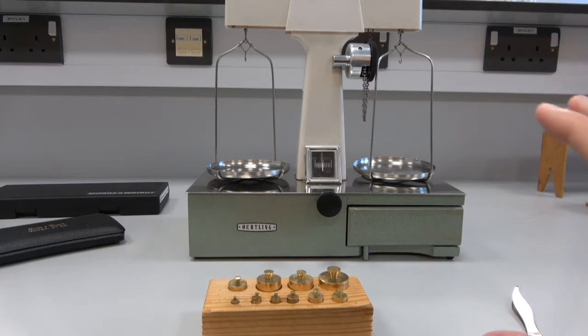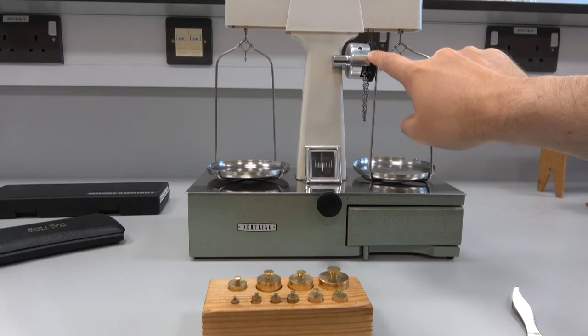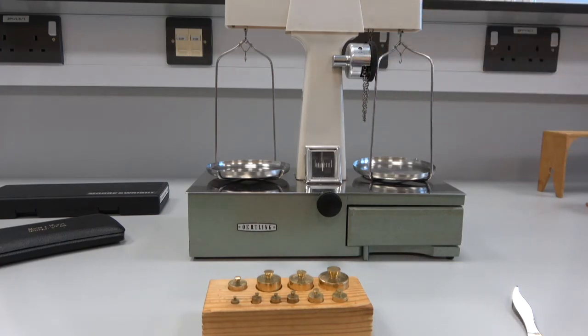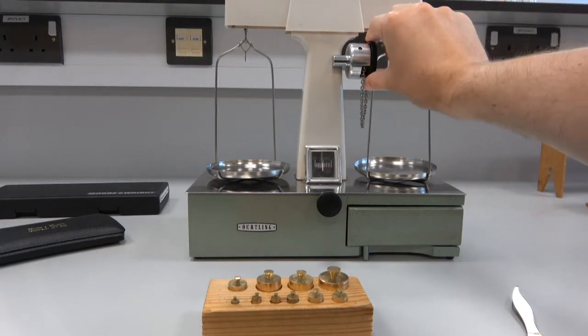The actual balance itself, though, obviously our masses only measure to one gram, but the balance you can be more precise with. So if you look at this dial up here, and I'll insert a kind of photo of that in a minute, you can actually add in tenths of a gram to that.